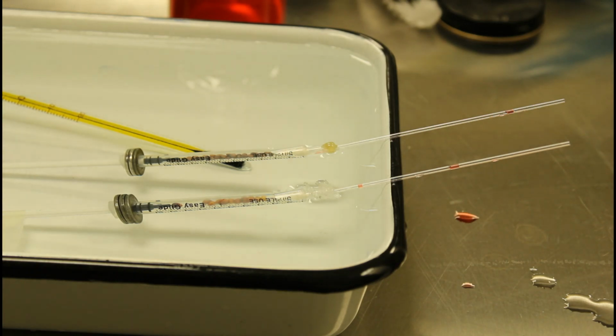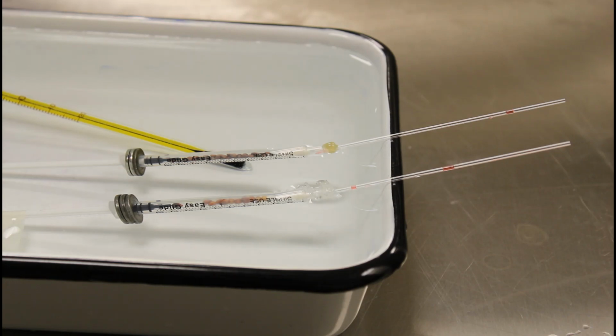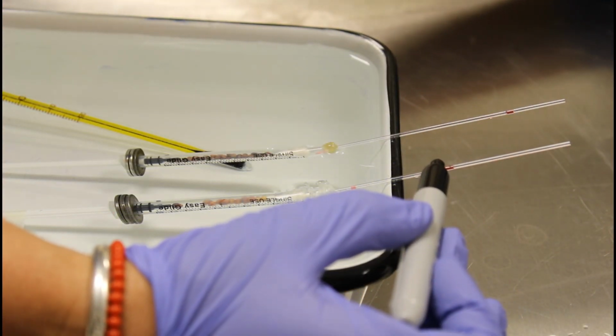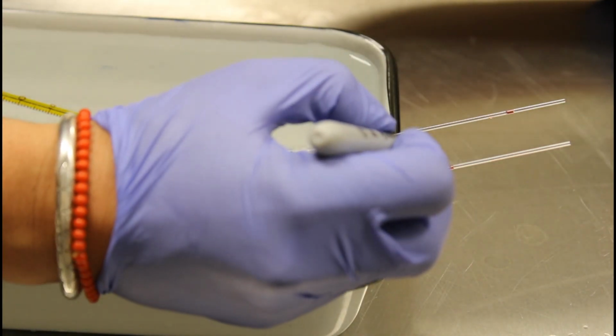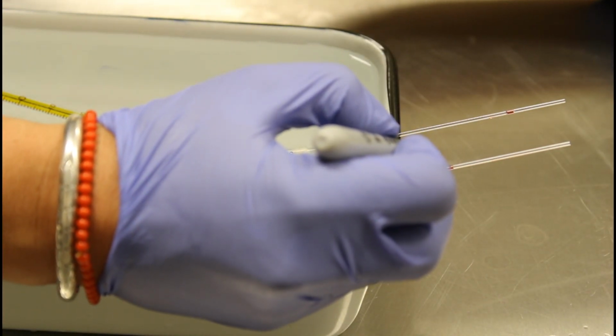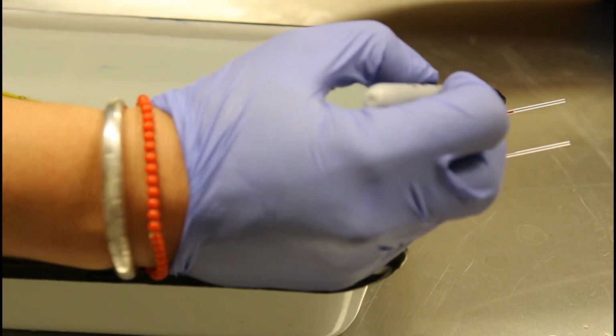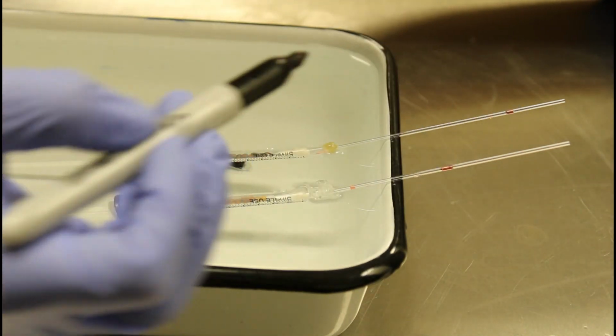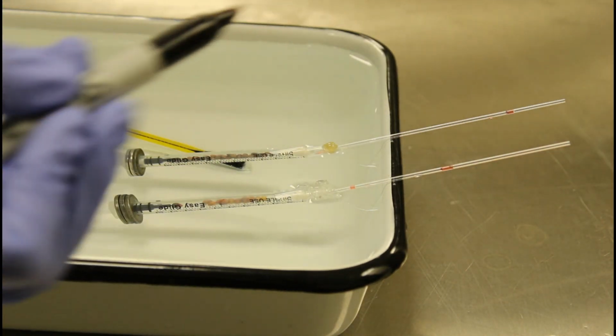And at this point, we're going to wait 5 minutes. So we're going to set a timer for 5 minutes. We'll come back in 5 minutes and we'll mark the position on each of the tubes once again. All right, so this has been going for almost exactly 5 minutes. So I can tell that the respirometer, the manometer fluid has moved in this chamber. So our original dot's up here. I'm going to put our next dot right here. It doesn't look like the control respirometer manometer fluid has moved at all. So there's really no place to put the second dot there.